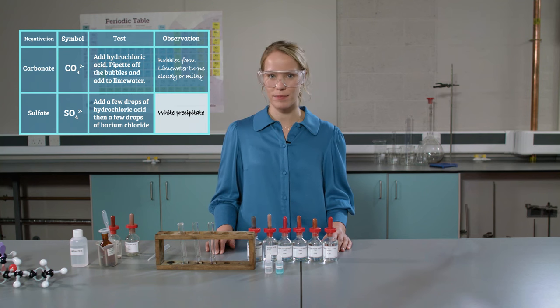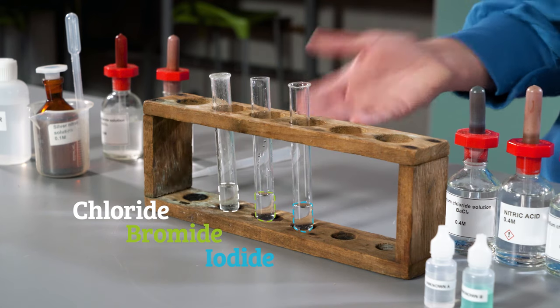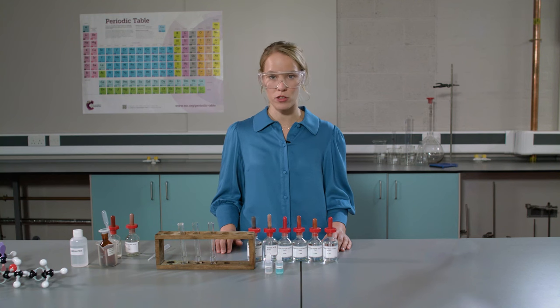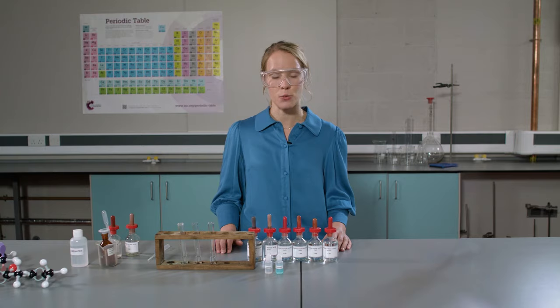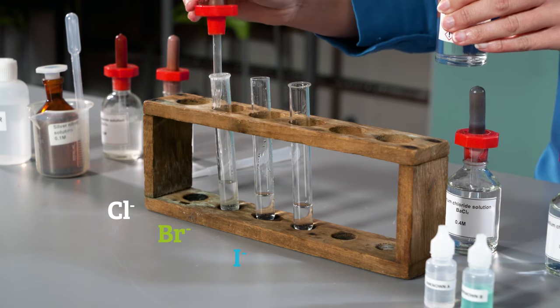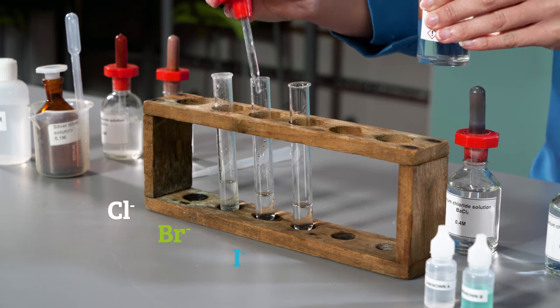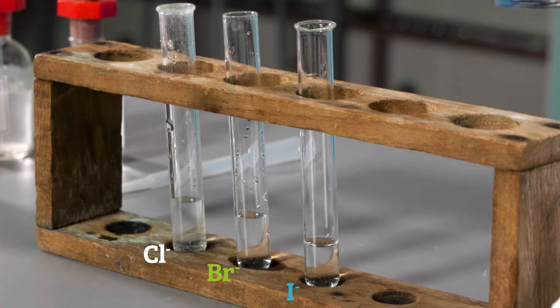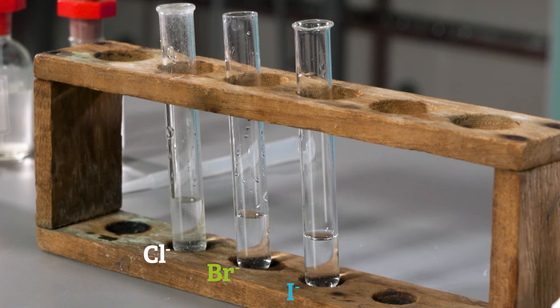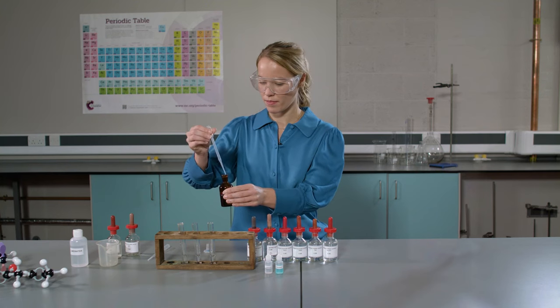Finally, we get to the halide test. I have a sample of each solution in a separate test tube. I'm going to start by adding a couple of drops of dilute nitric acid to each one, followed by a few drops of silver nitrate. Carefully observe what happens.